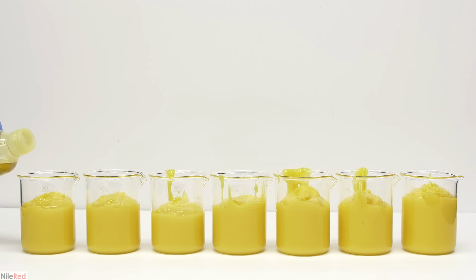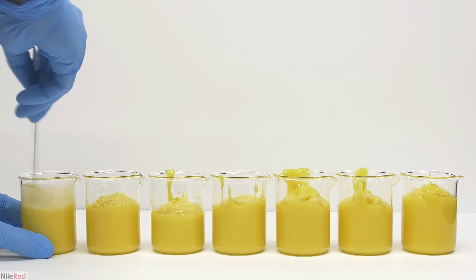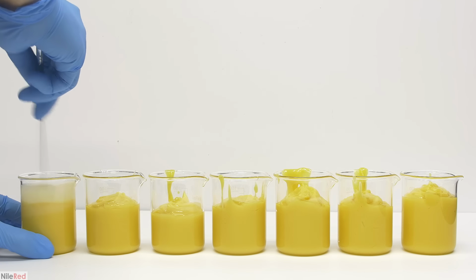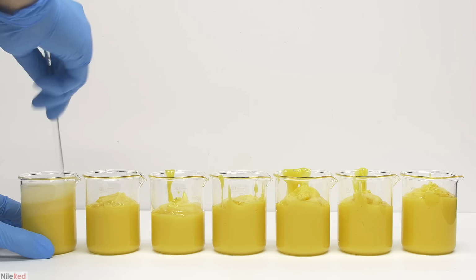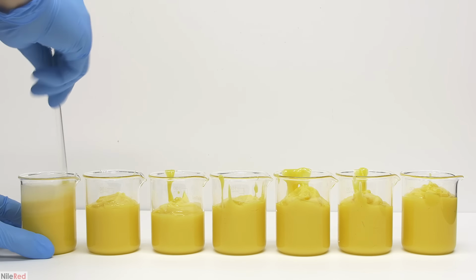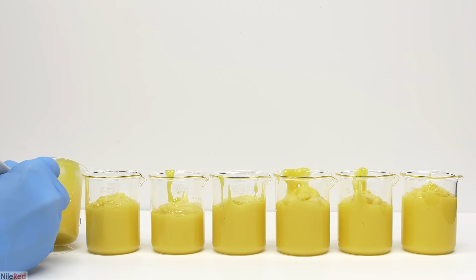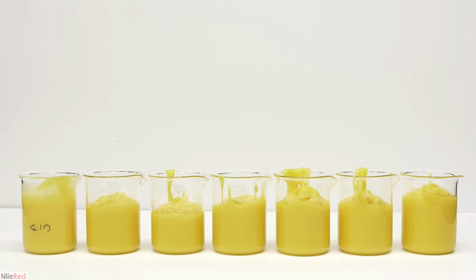To the first beaker, I added essential cinnamon oil, which is pretty much just pure cinnamaldehyde. Then using my stir rod, I mixed it up as best as I could. One thing to point out is that I'm not an expert at all with this, and in each case, I think I added way too much stuff. When I was done, I quickly marked the beaker CIN for cinnamaldehyde, and then moved on to the next one.